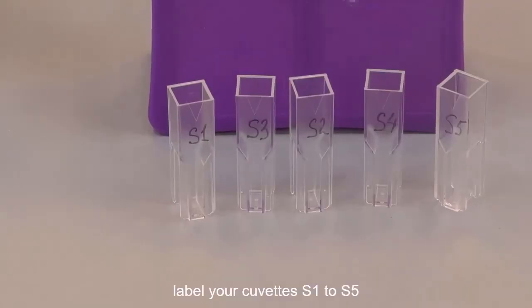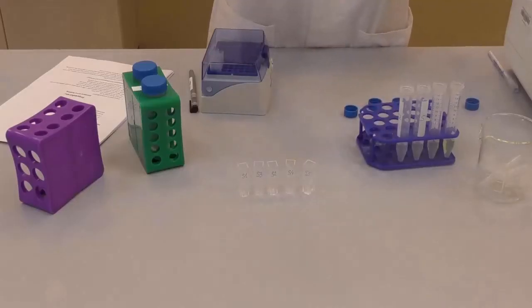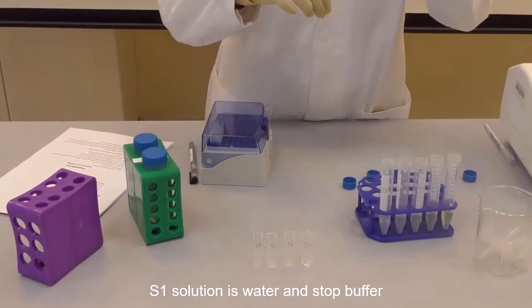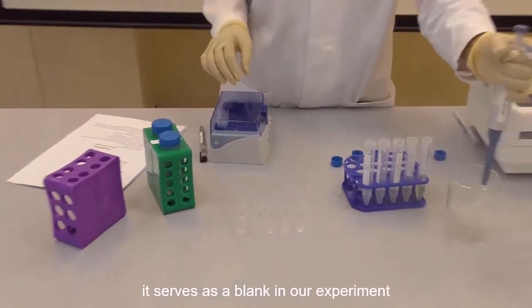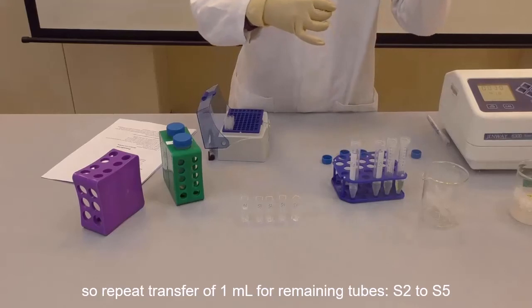Label your cuvettes S1 to S5, and then transfer 1 ml of S1 solution from the 15 ml tube to the spectrophotometric cuvette. S1 solution is water and stop buffer. It serves as a blank in our experiment. We are going to use it to calibrate our measurements. Repeat with the transfer of 1 ml of remaining tubes S2 to S5.